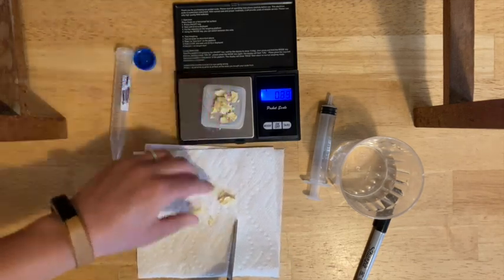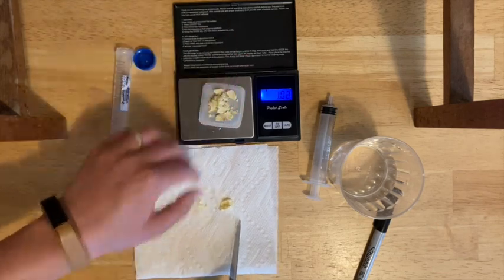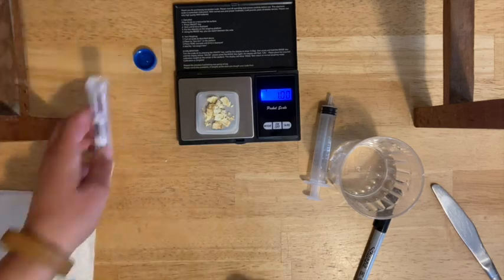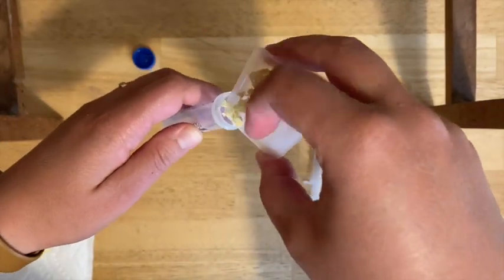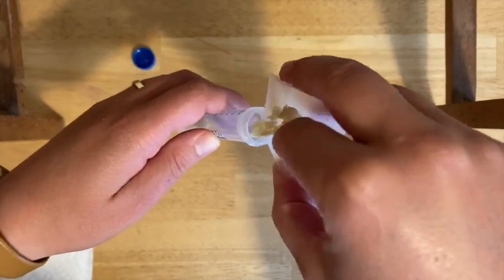You may need to cut a little more — that's fine. Try to get as close to one gram as you can. Now you're going to rehydrate the pineapple, so take all the pieces and get them into your tube. Try not to lose any before you add the water.